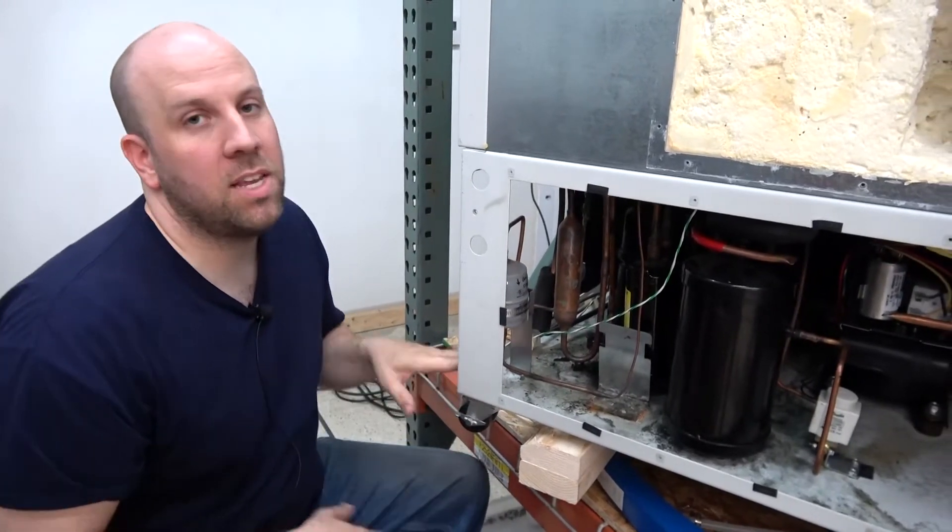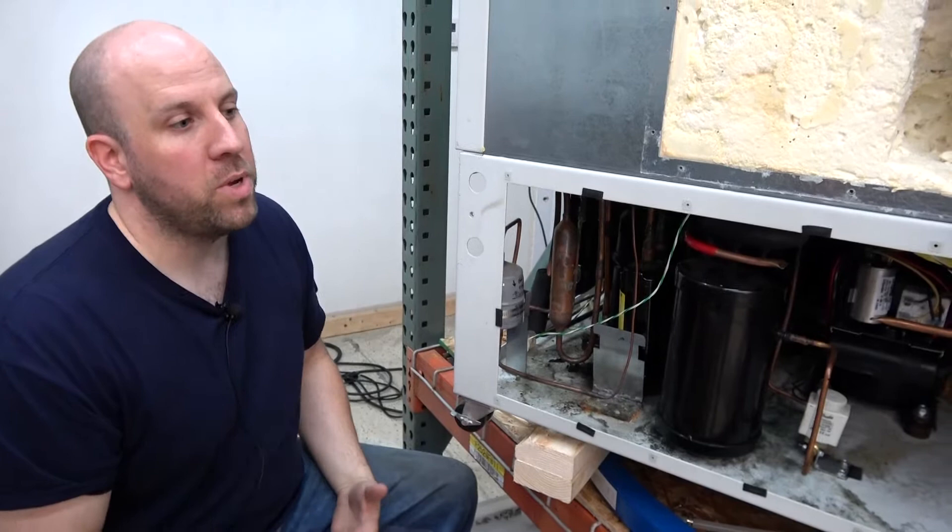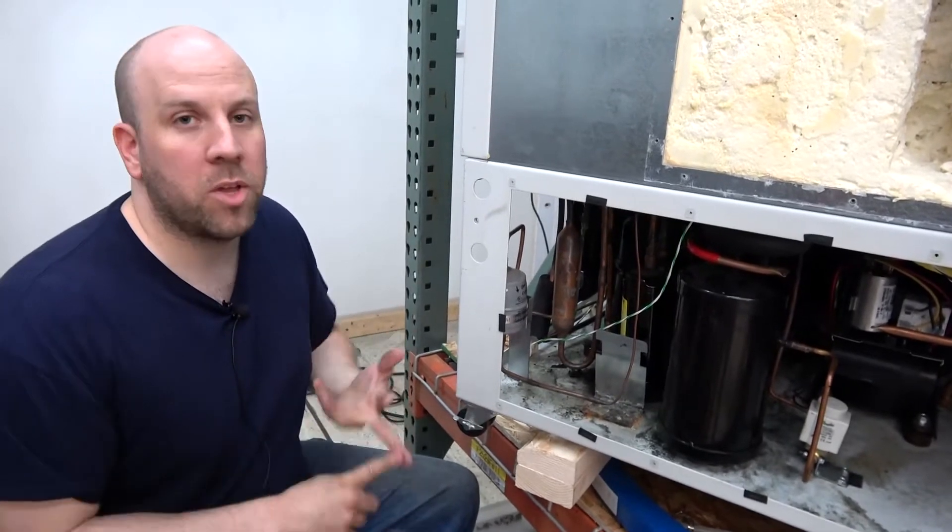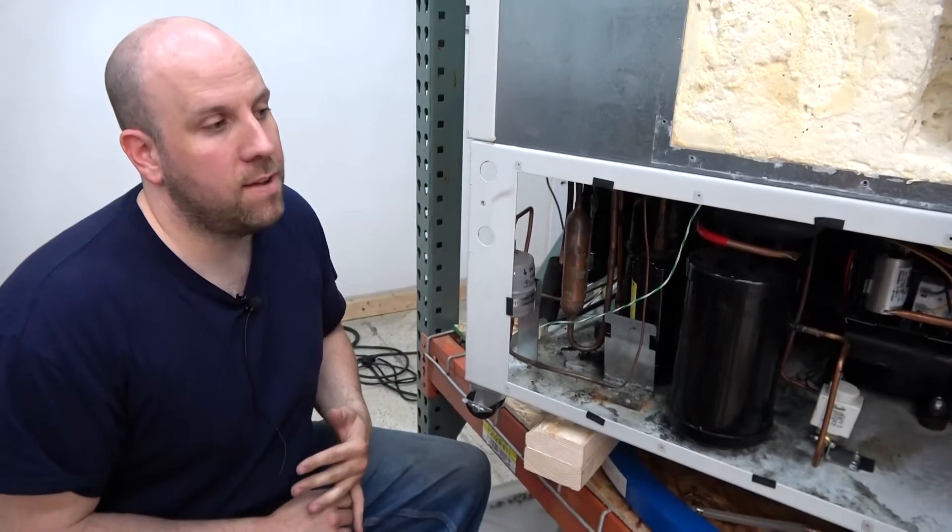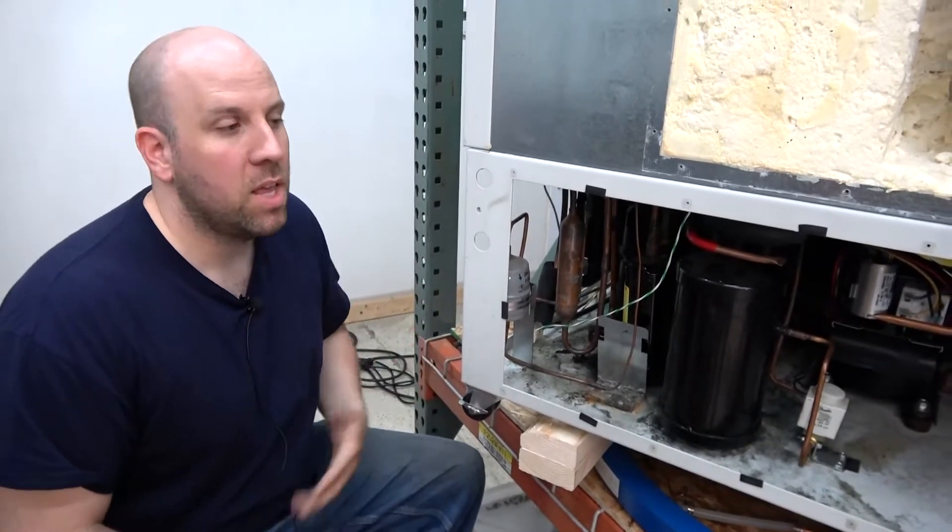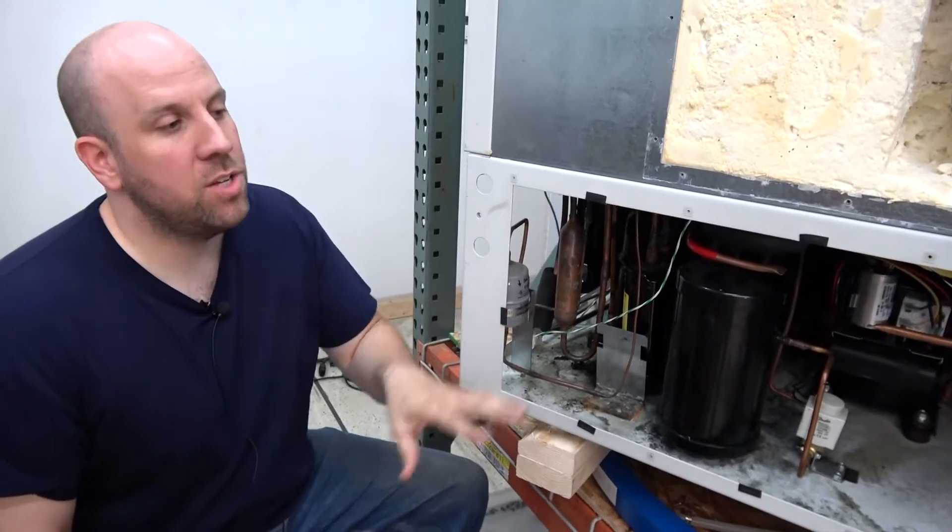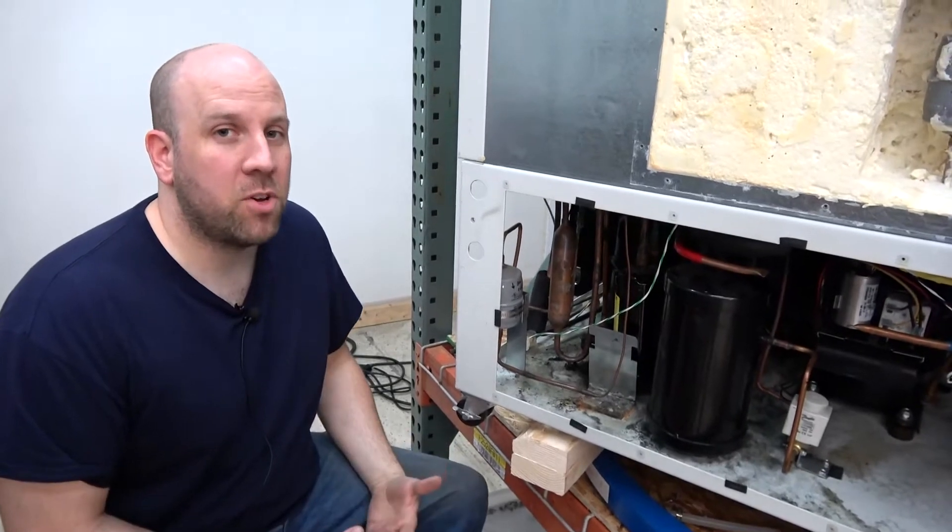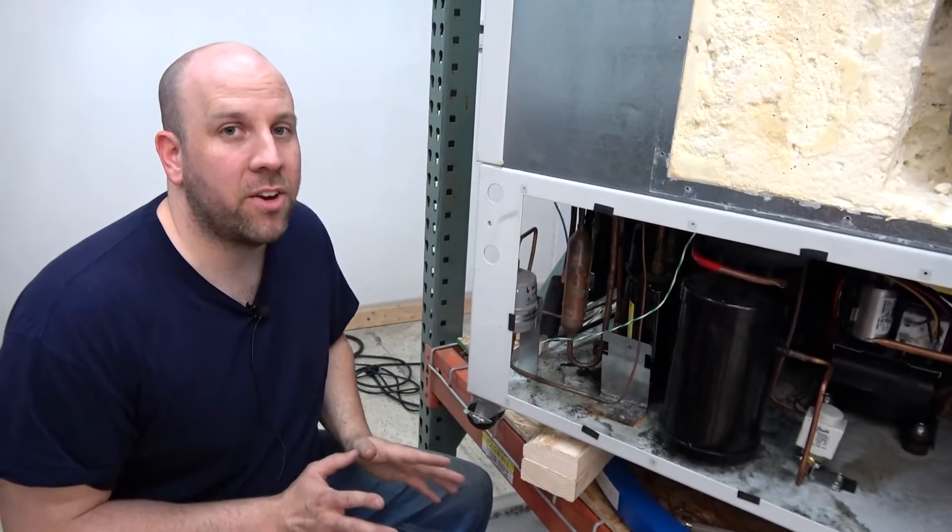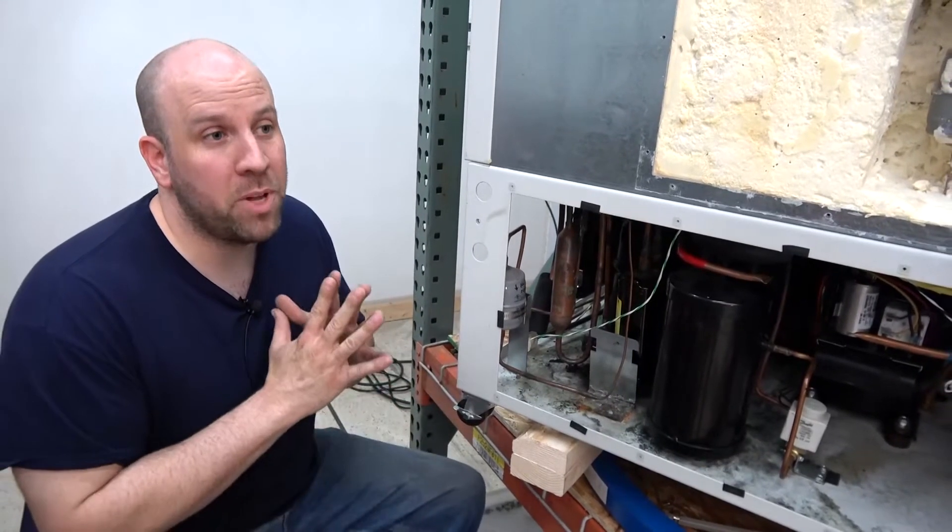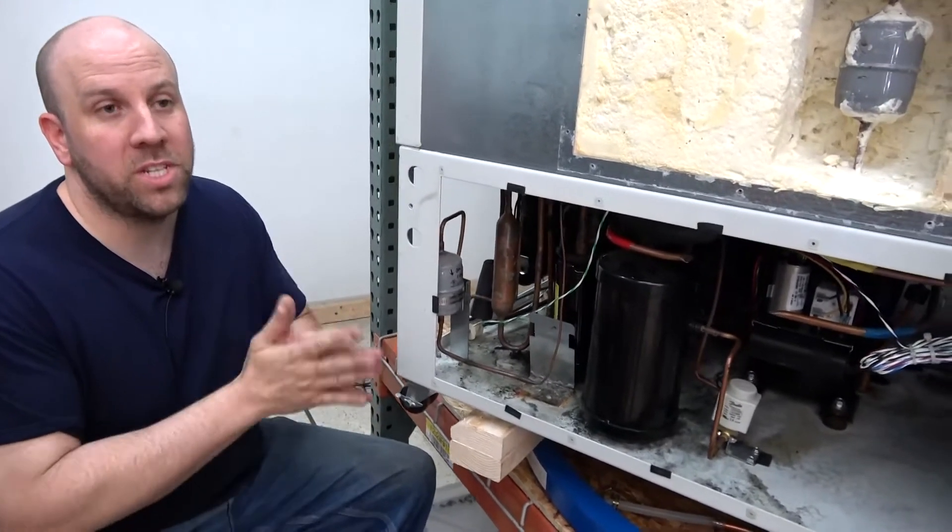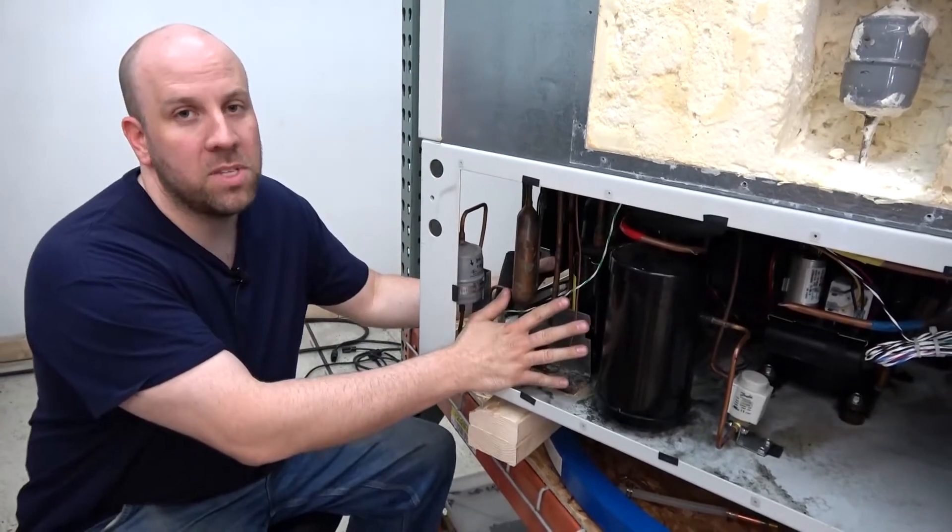So what we do is when we get these in, we test them. We test their cooling abilities, how long the compressors run, the current they draw, all that stuff. Then we make a determination. If the first stage reaches negative 45 to negative 50 degrees Celsius within about 10 minutes, the first stage is good because that's all its purpose is—it reaches that temperature to pull heat from the second stage.